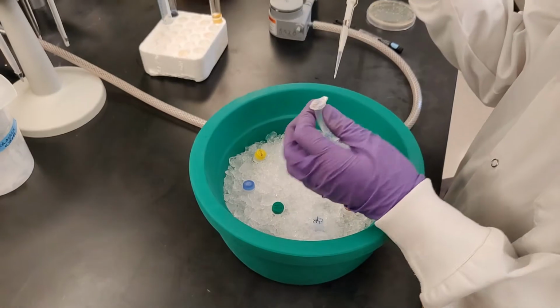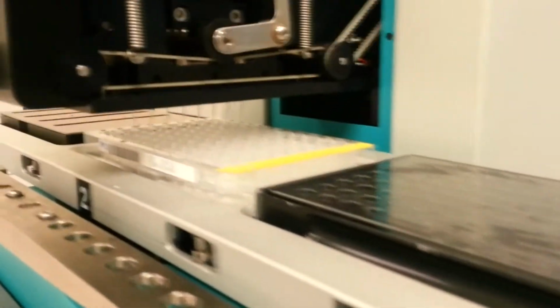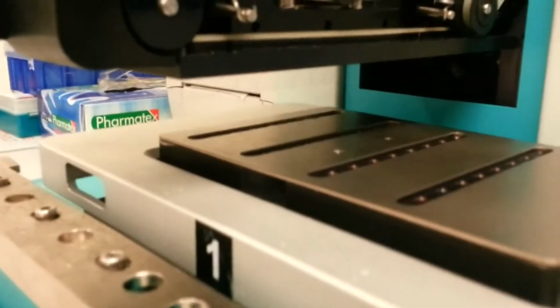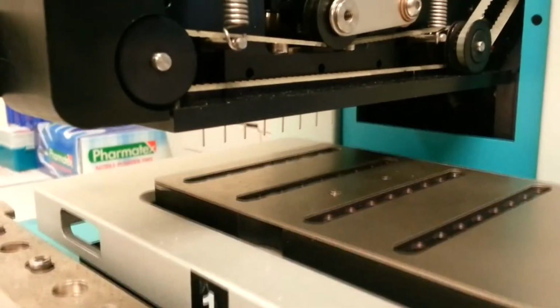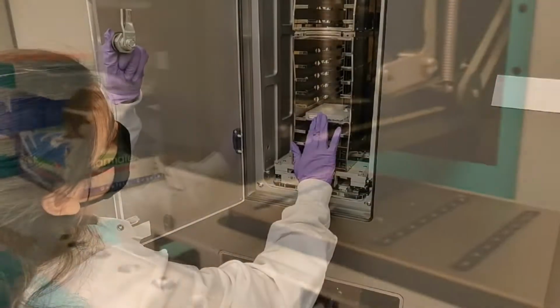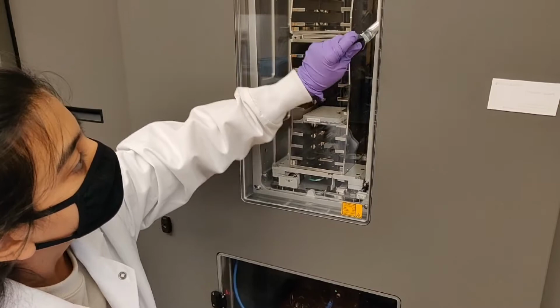Now that our protein sample is ready, we can do structural analysis on it. To reveal the structure using X-ray crystallography, one needs to first crystallize the protein. This is done by chemical screening in plates such as these. We use robots like the Mosquito and the Dragonfly to automate the chemical screening process. This crystal hotel stores these plates and images them at regular intervals to check if a condition becomes suitable for crystal growth.